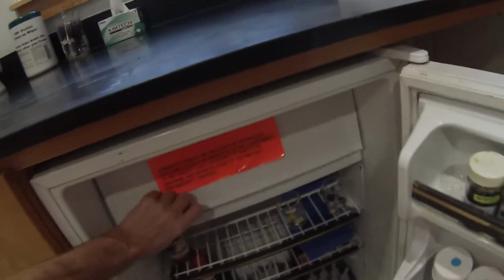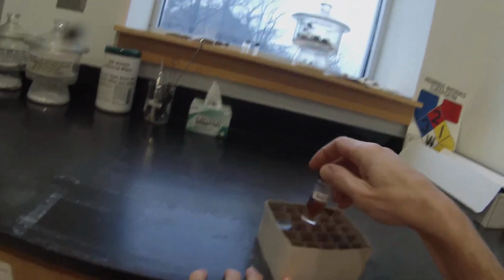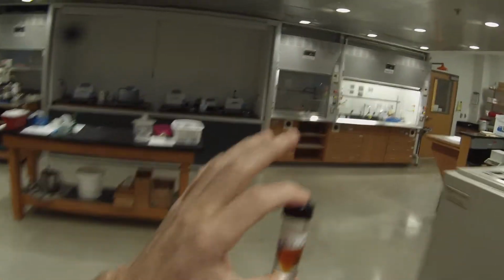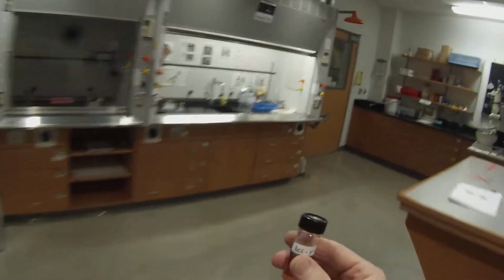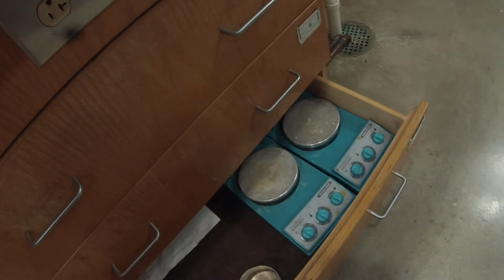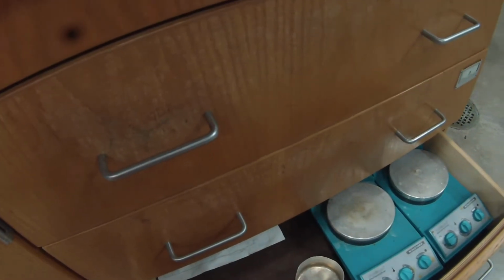So I allowed that vial from the morpholine reaction to sit in the freezer for an additional day after we added that little bit of ether and then scratched the walls, and you can see that nothing has happened. It's still orange, and still no solid forming. So we're gonna have to mess with it some more.